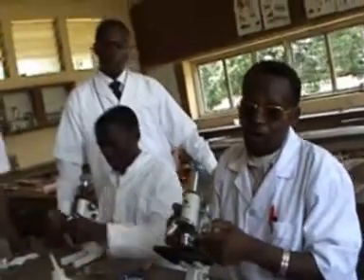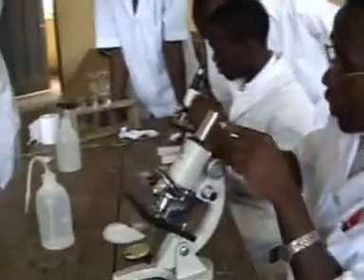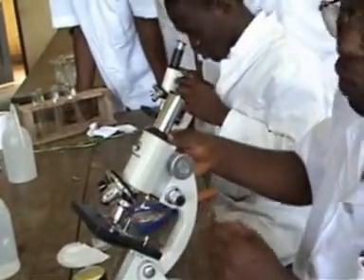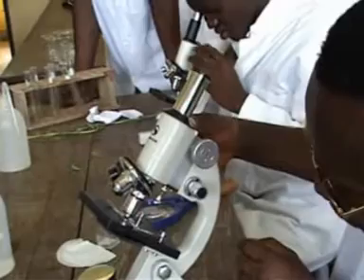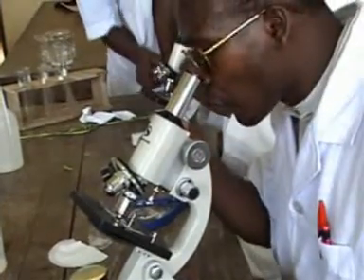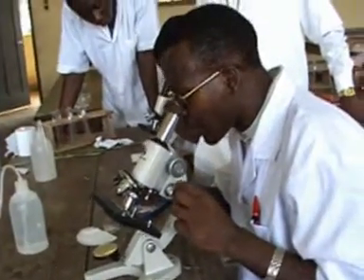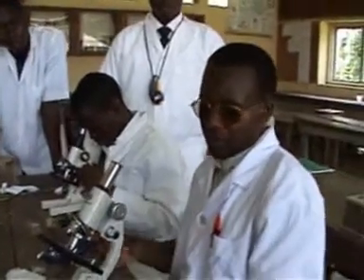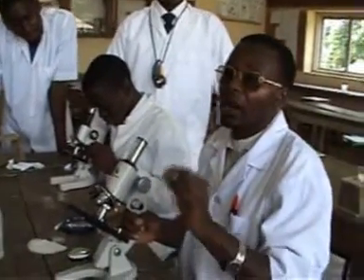So if I could not observe it very well under this one, I could take it also to this oil immersion lens. So when I take it now, I take it down without looking through the eyepiece, but I look on the side. Because if I'm not looking on the side, there's a possibility that this long oil immersion lens can break my preparation. So when it is touching it just slightly, I will stop there. Then I will look here to see what I've observed, and then I will use the fine adjustment knob to take it up gradually, and eventually I will see the cells. So when I see it now, I will locate a group of cells, about 6 cells as the question is usually asked, and these cells are preferably around a stomata.